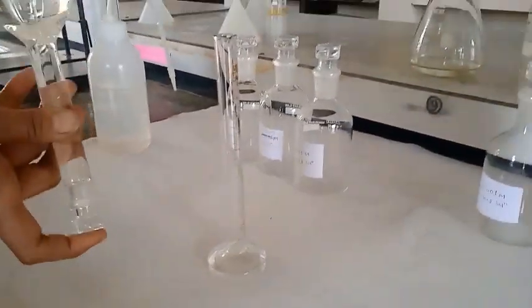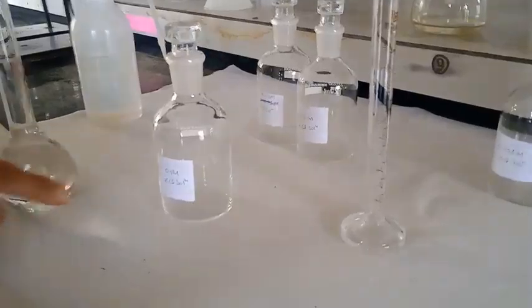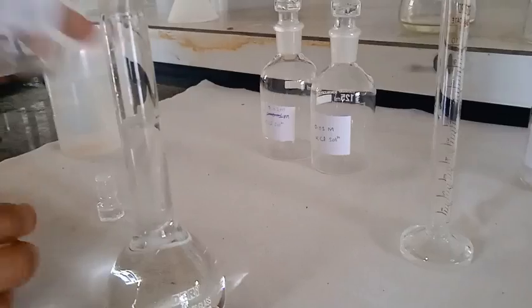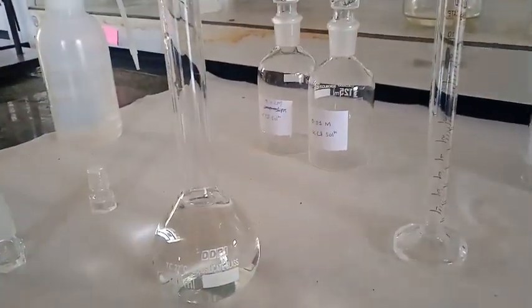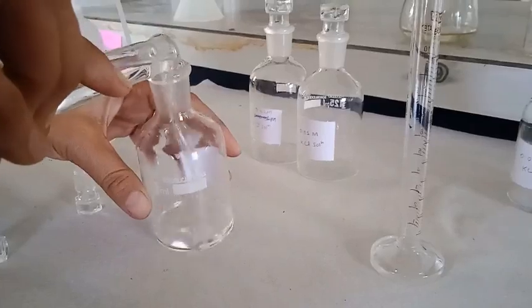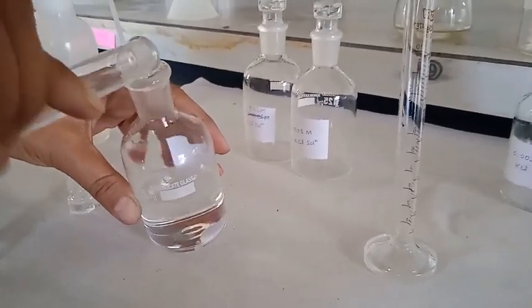Now I am going to transfer it into the reagent bottle which is already marked with 0.1 molar KCl solution. Before adding the whole solution I am just going to rinse the bottle, and now I am going to transfer it into the reagent bottle.